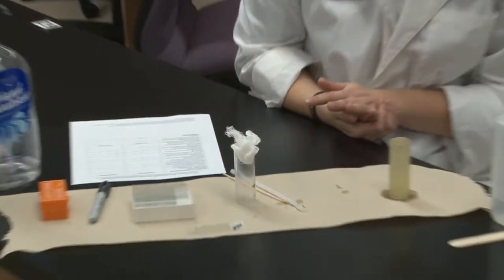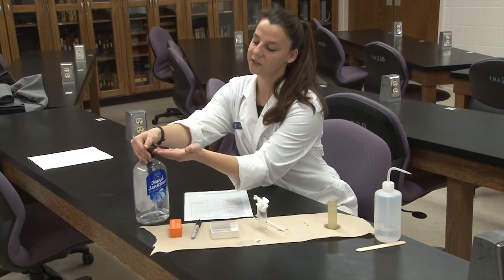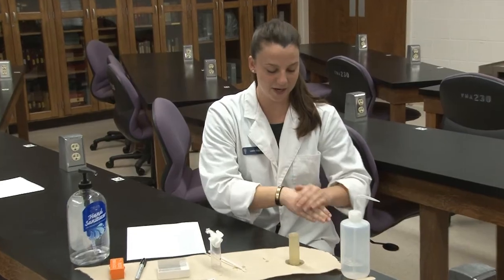And there it's ready to be presented to the judge. All you have left to do is clean your hands. A little hand sanitizer will take care of any organic material that may have transferred to your hands in the process. Good luck on your competition! Have fun studying!